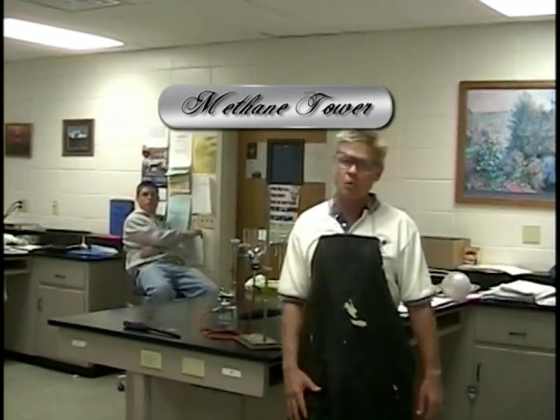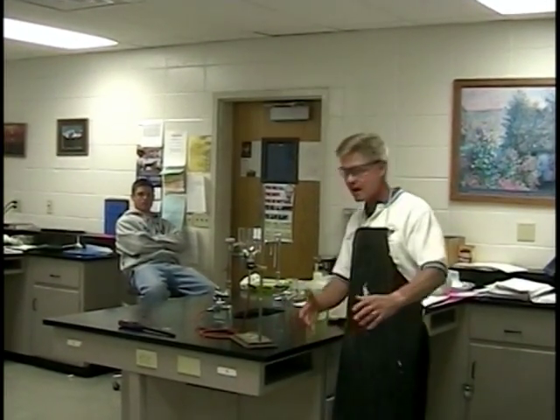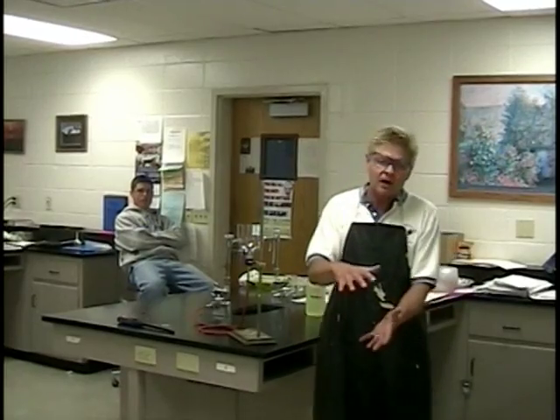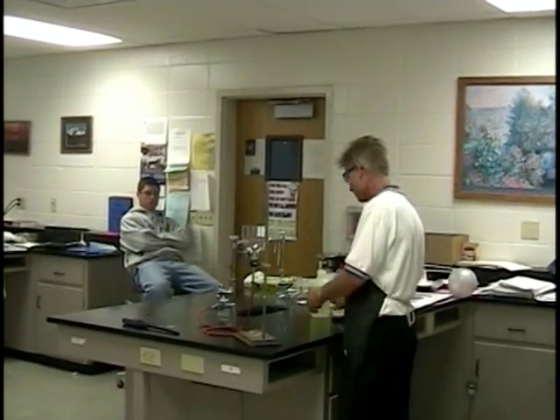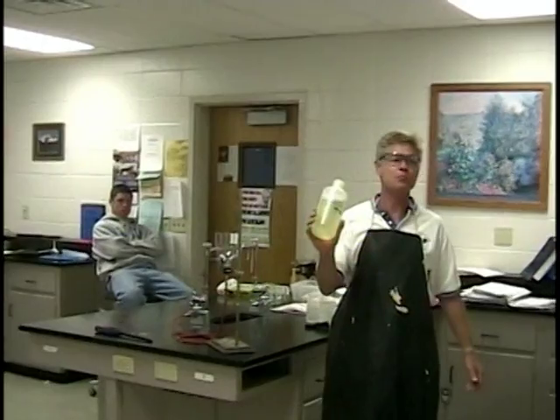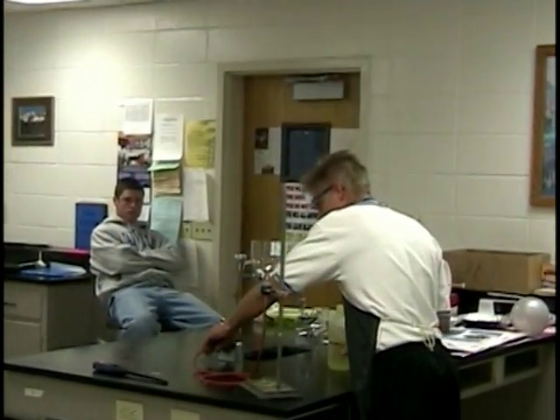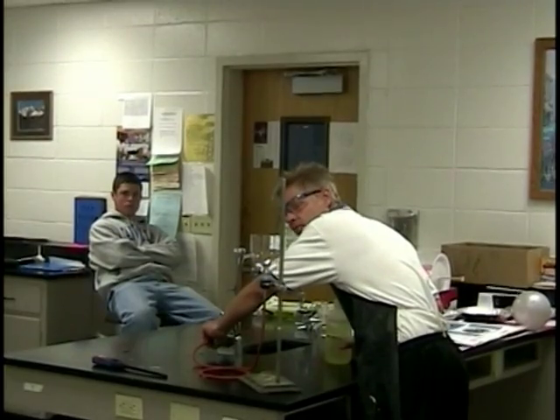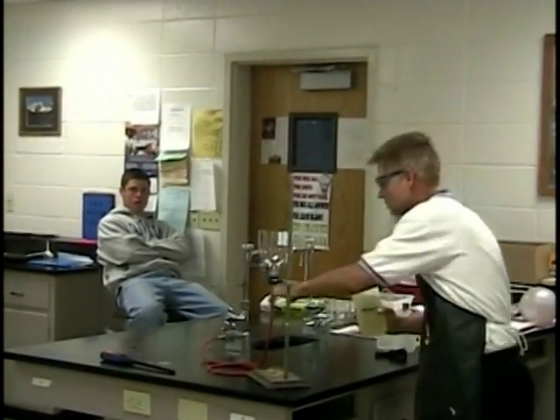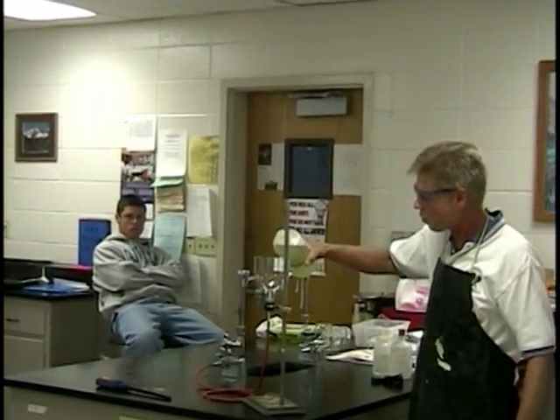Welcome to Coach Moe's Chemistry Corner once again. Today we're going to look at methane — kind of like a methane bubble tower. We've got about a 3% soap solution here that I mixed up earlier today, and of course you have to have a methane supply of gas. We have our methane bubble generator and watch what happens.